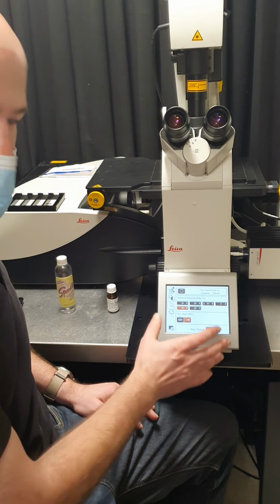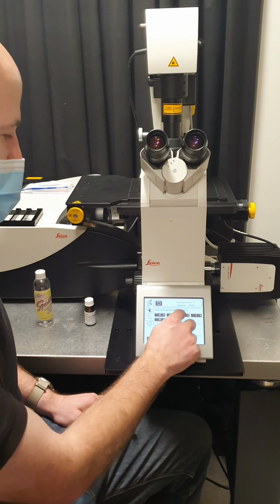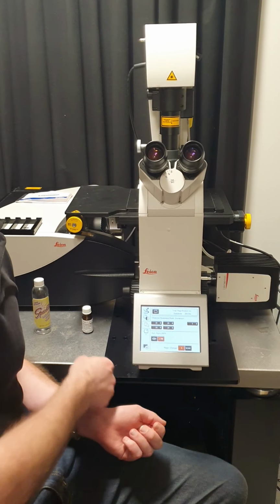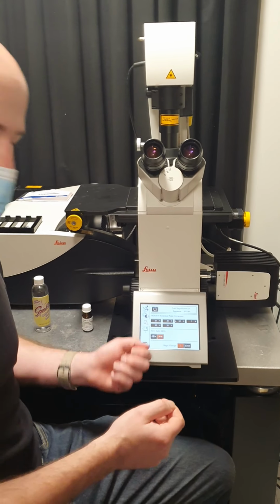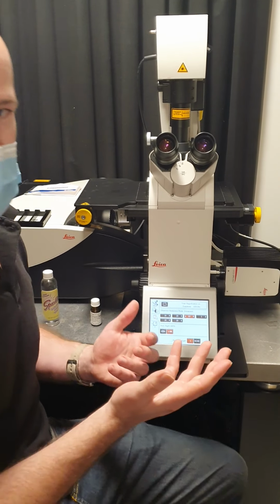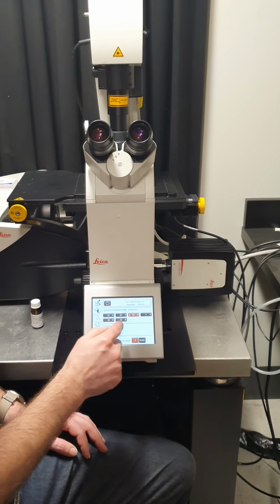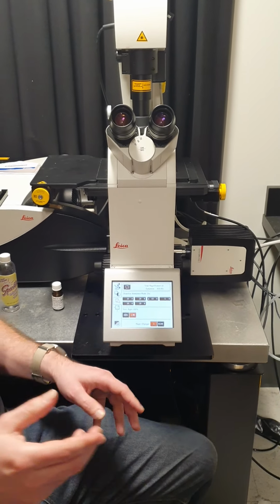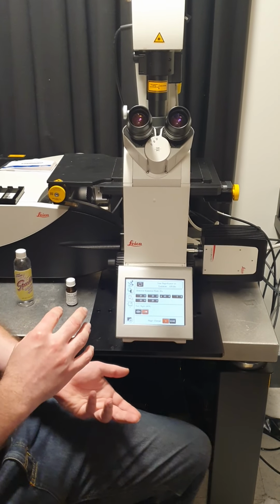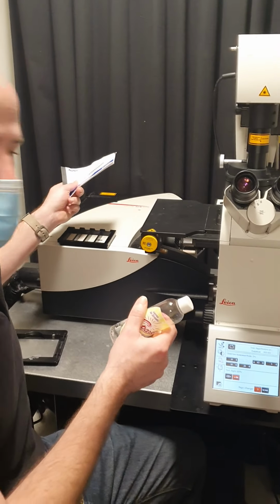If you're going from any of the dry objectives to the immersion objective, you click on it and it will blink, but here it didn't actually move. That's just to give you a reminder that you need to put on the immersion media. Once you do that and click it again, then it will actually move. And it'll do the reverse when we're moving from the immersion objective to any of the dry objectives, to give you a reminder that you need to clean off the immersion media from your sample and from the objective. And we've got lens paper and lens cleaning fluid here.